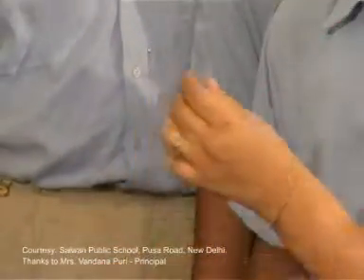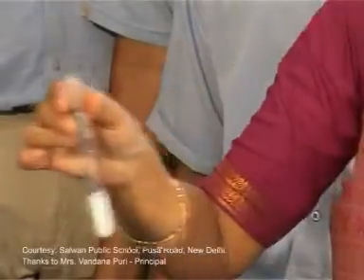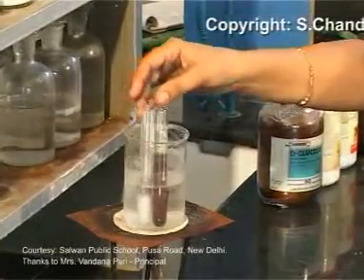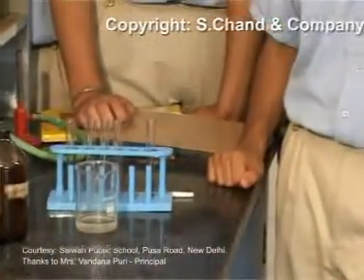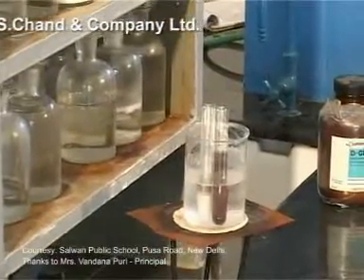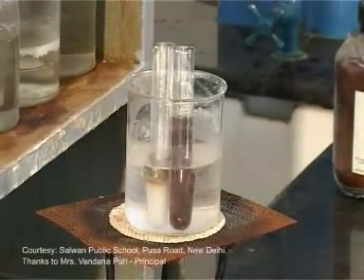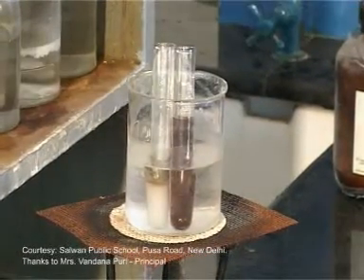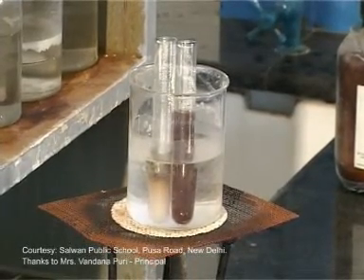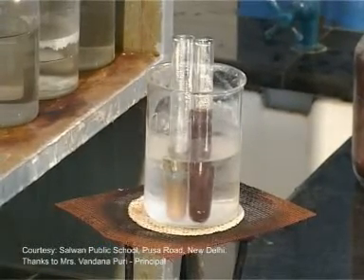Now keep this test tube in a boiling water bath for about 5 to 10 minutes. After 5 or 10 minutes, you will find metallic silver — that is, silver mirror formation along the sides of the test tube — again confirming the presence of glucose.